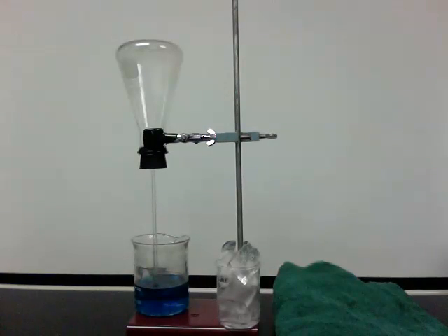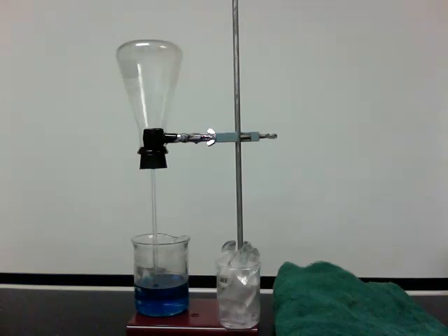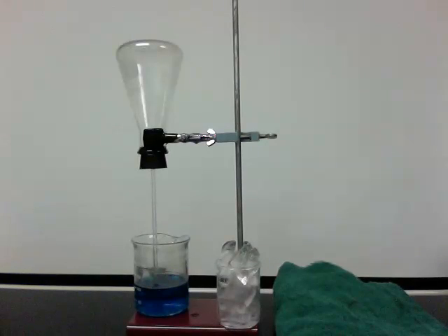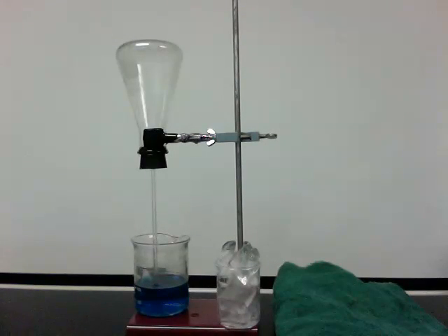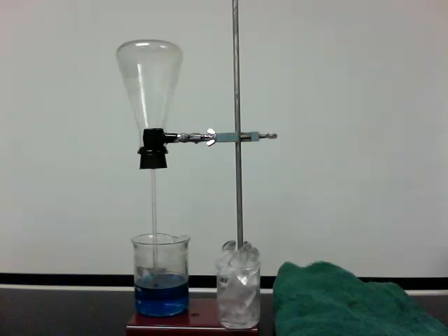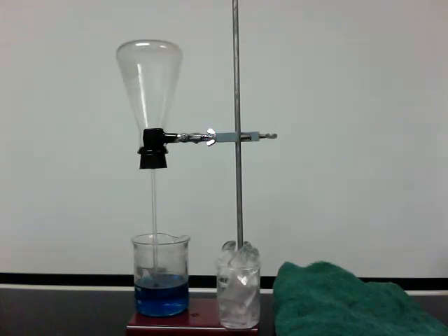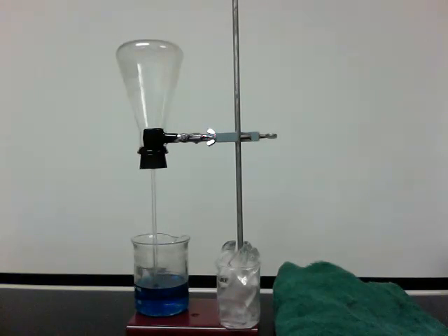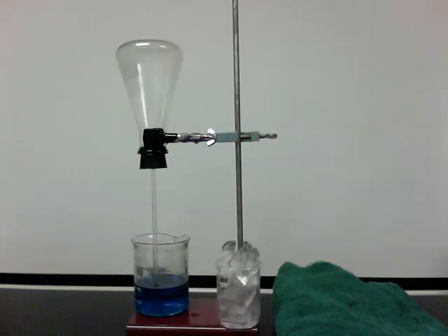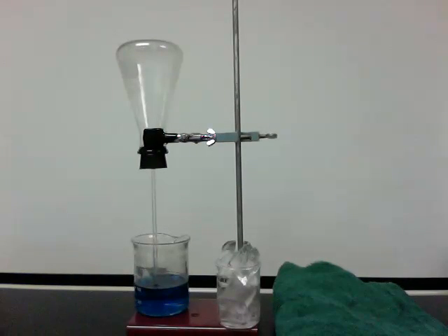This is a recreation of the flask lab, designed for students who are not in class. The question is: how do changes in air temperature inside of the flask affect the colored water in the beaker below?